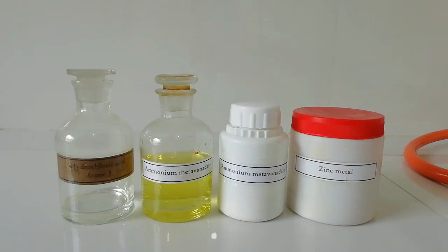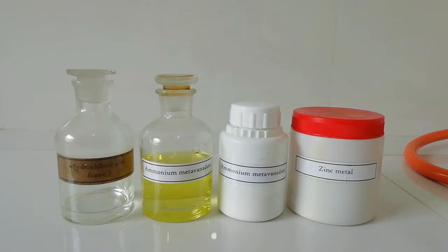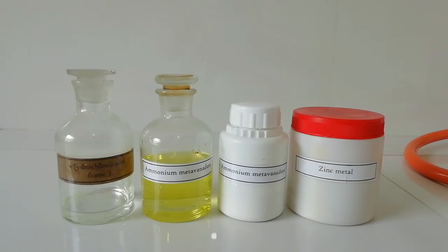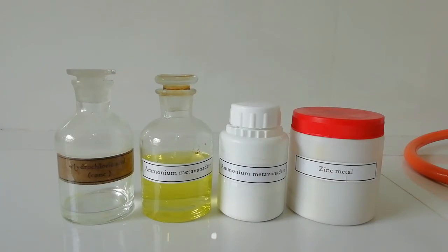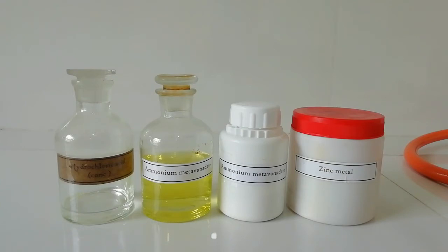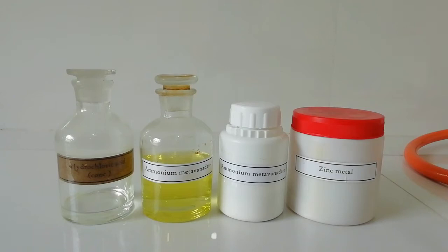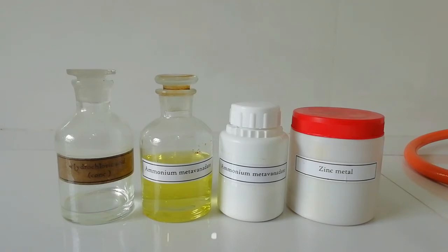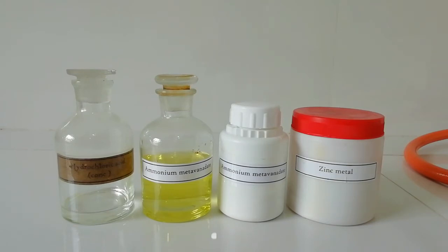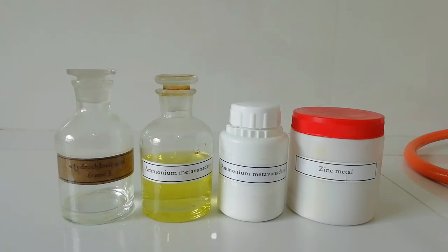The solution is yellow in color and the concentration is about 0.068 molar. Ammonium meta vanadate is a white salt, but it can be slightly yellow due to impurities of vanadium pentoxide. This salt is also a little bit expensive. I also want to mention that I now have a Patreon page — you can support me there so I can purchase more expensive chemicals.